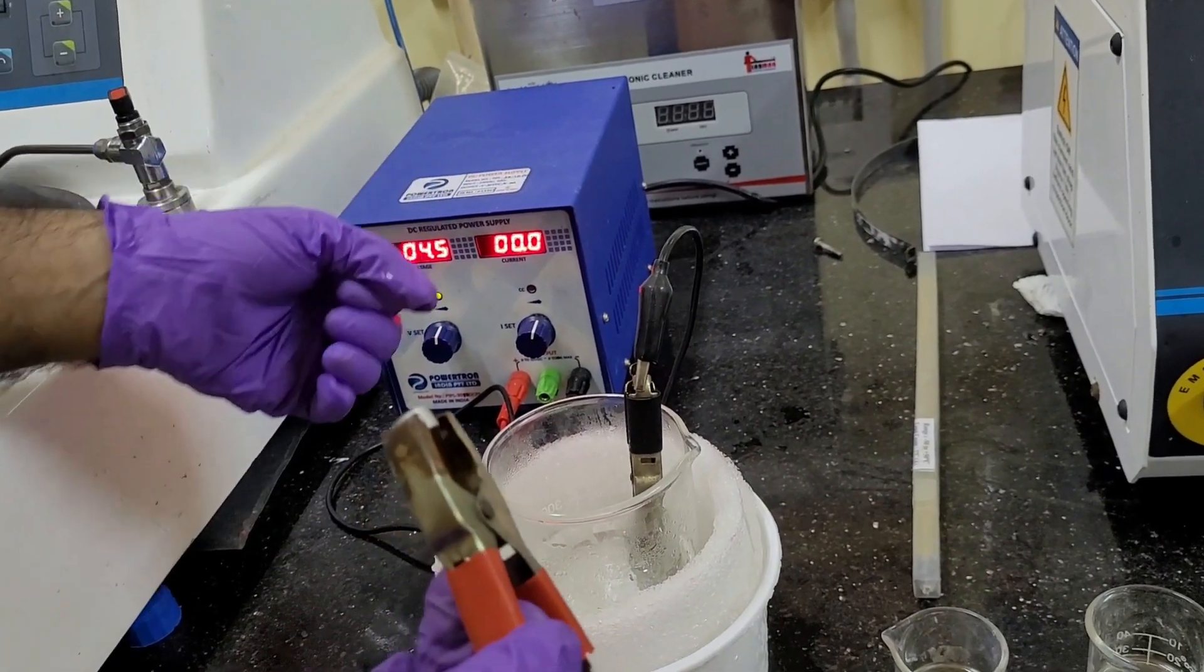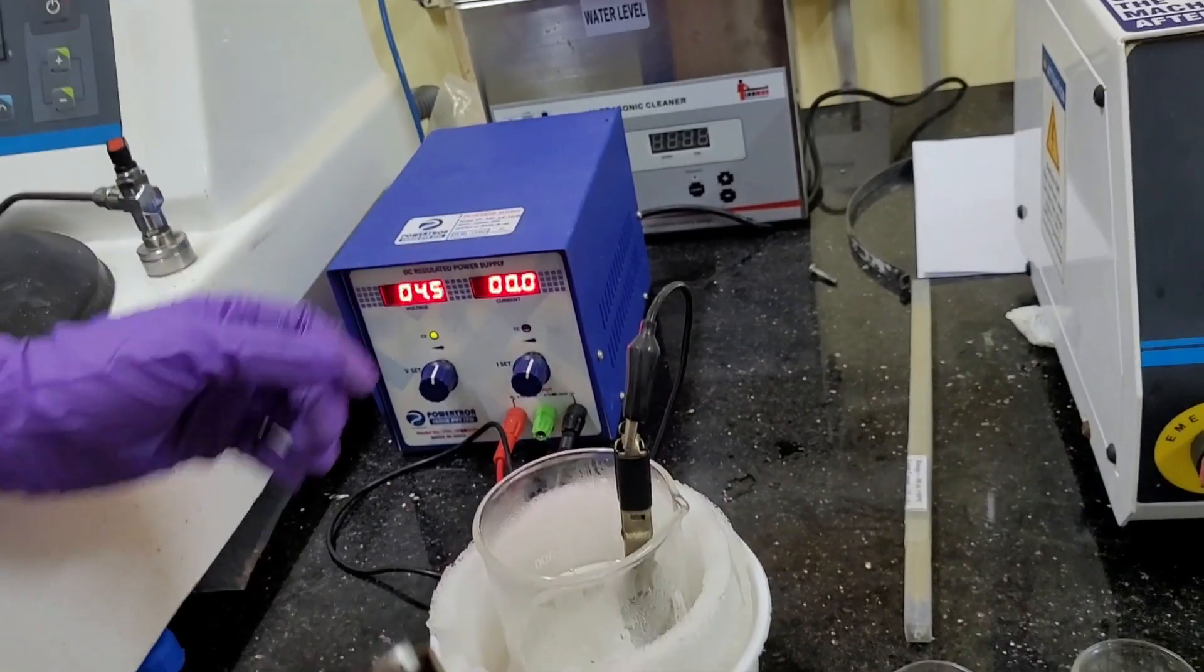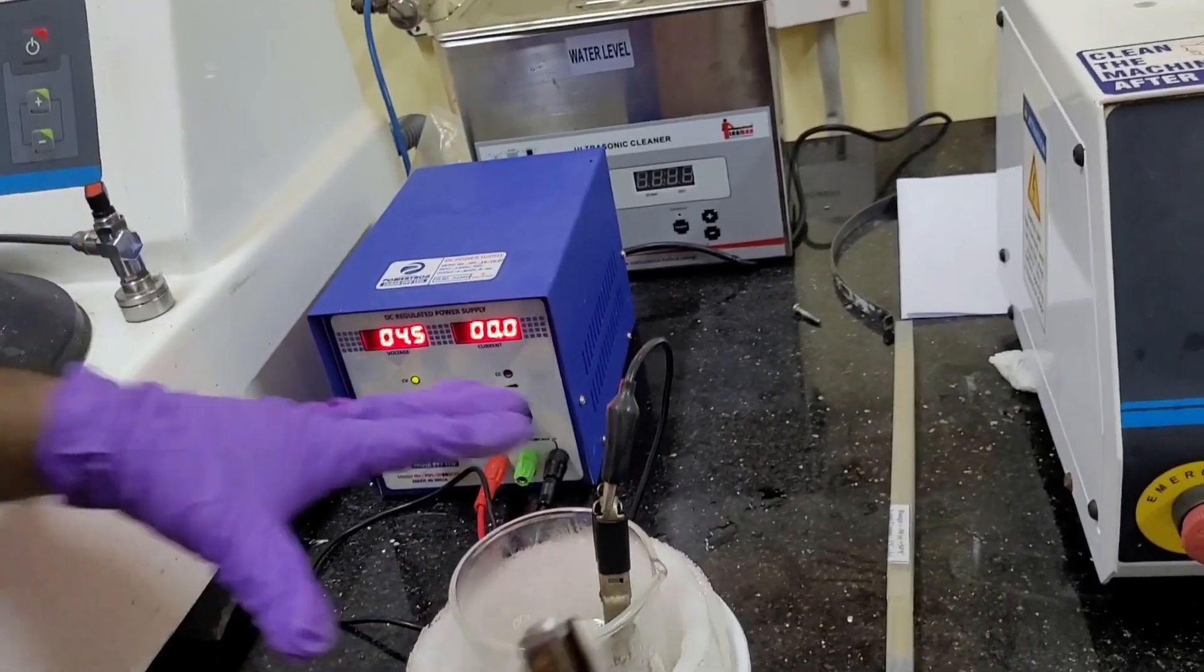And first, we have to again, check remaining parameters. So, that we can achieve the, our optimized current. So, here we are going to start the experiment.